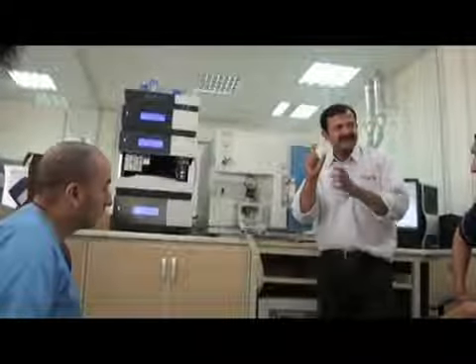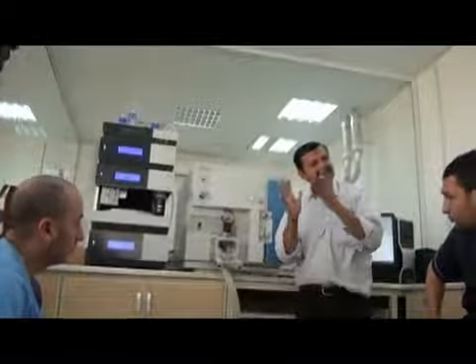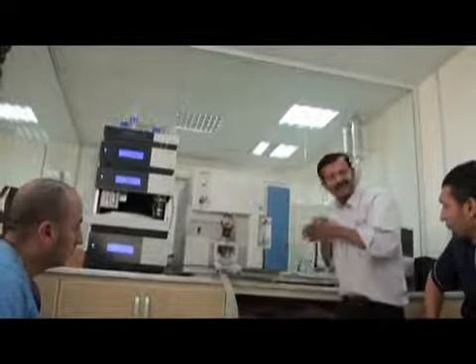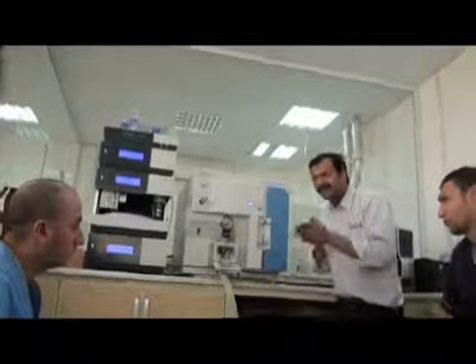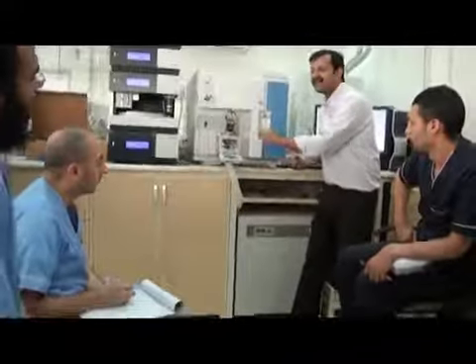When you press it, it comes out as a spray because of this pressurized air. The same technique here: we use this nitrogen gas to make a spray, not only liquid coming down. A portion of the spray will go inside because this system is under vacuum. It will suck.